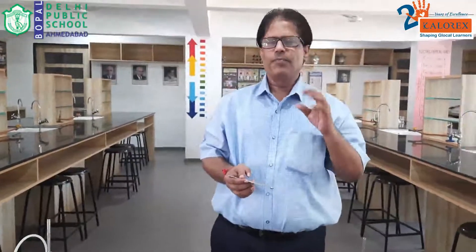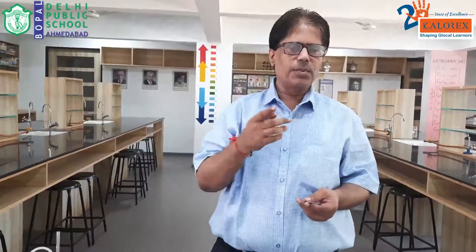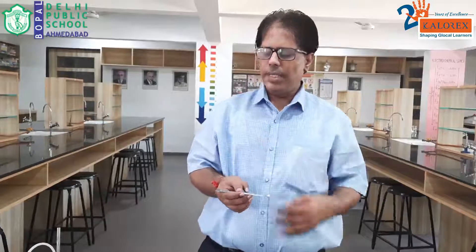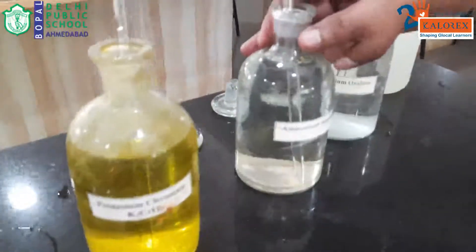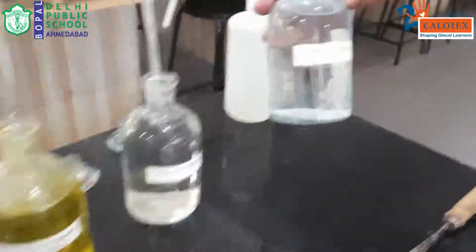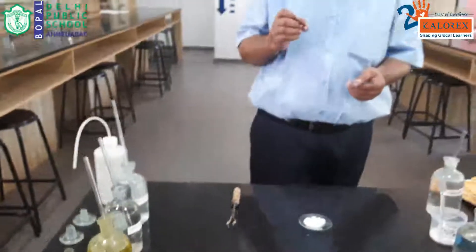Group 5 is present. We will now go into the analysis of Group 5 to identify which ion it is. Group 5 contains Ba²⁺, Sr²⁺ and Ca²⁺ — all forming white precipitates. To distinguish them based on solubility, we first check for barium ion using potassium chromate as the reagent. If barium is absent, we test for strontium using ammonium sulphate. If both barium and strontium are absent, we test for calcium ion using ammonium oxalate.